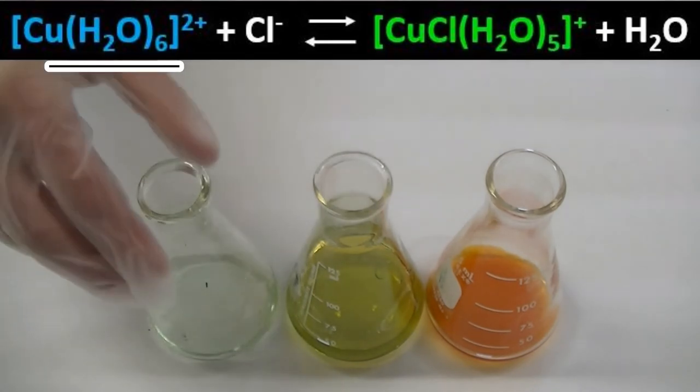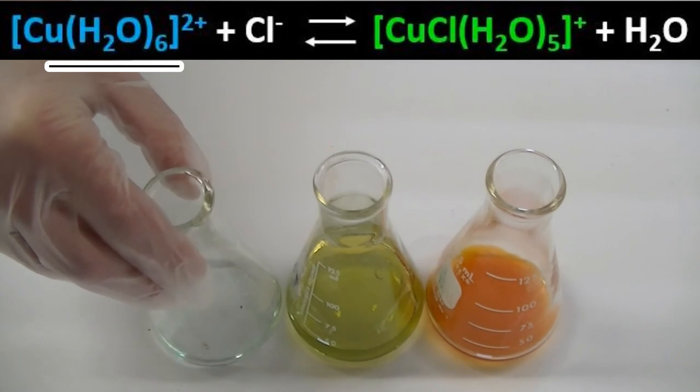Once again, water shifts the equilibrium in the reverse direction from right to left.